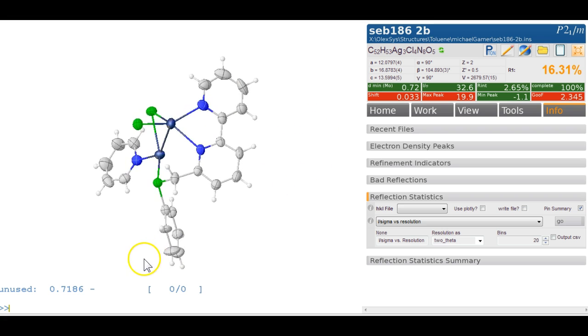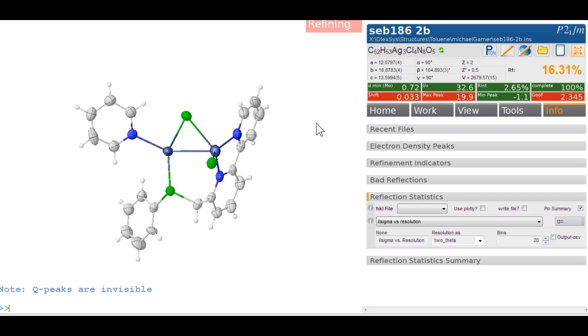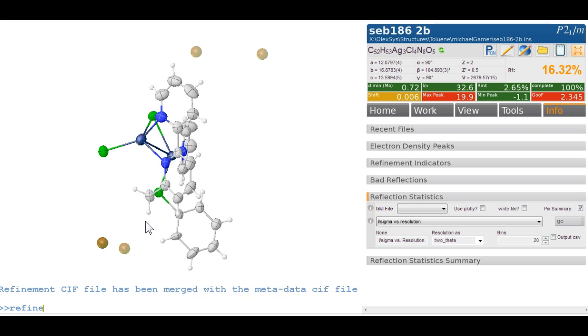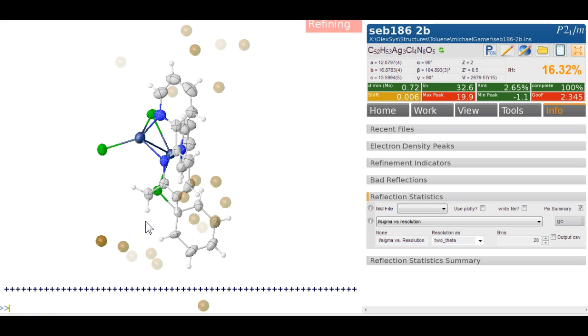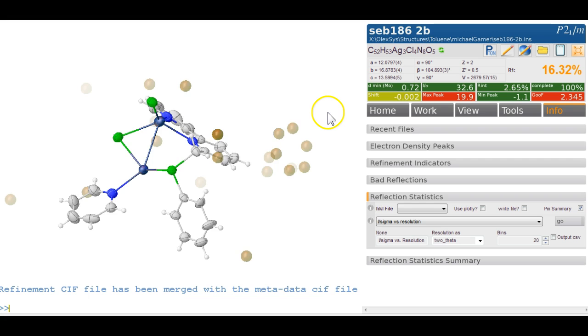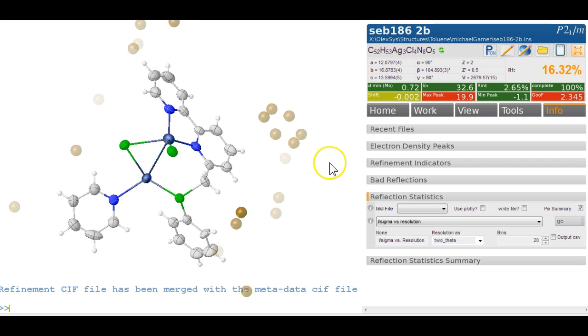So obviously there's going to be some solvents, counter ions, things floating about. We can already tell there's a peak of 20. So let's refine this. Control R, and I'm going to use keyboard shortcuts for this. Q peaks are invisible, so Control Q shows the peaks. Now that's not anywhere near enough peaks, so we're going to refine 4 cycles and 20 peaks and see what we get. So instantly we know there's a couple of rings here, so that looks pretty good. That's probably just a standard pyridine, I would say.